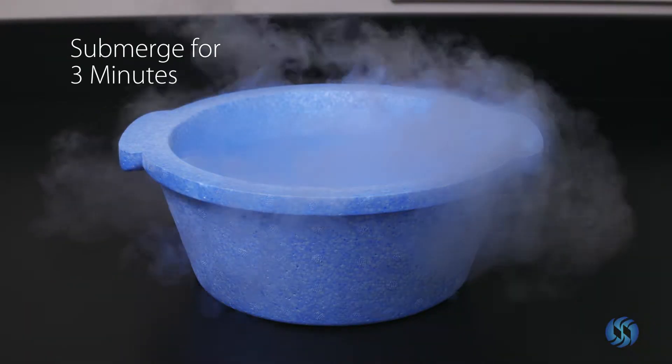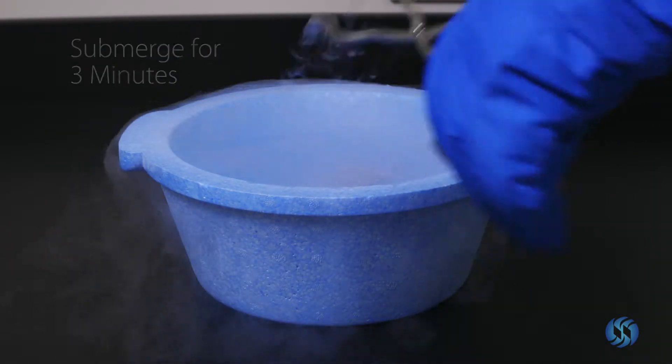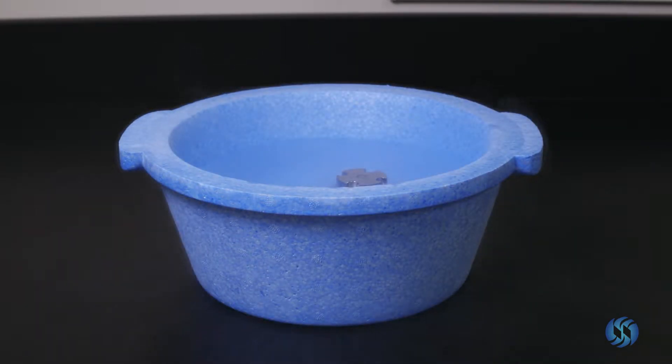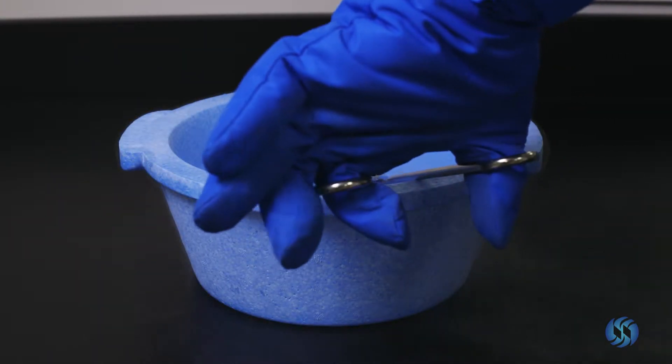Submerge the milling jar in a liquid nitrogen bath for three minutes. When ready, remove the jar from liquid nitrogen.